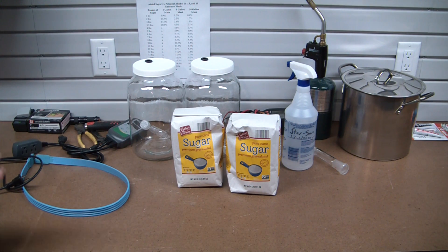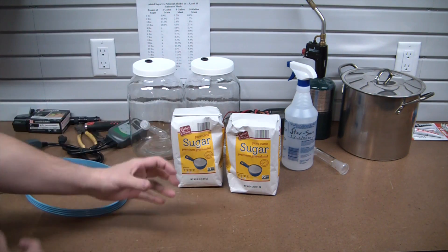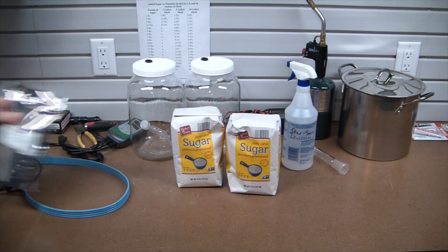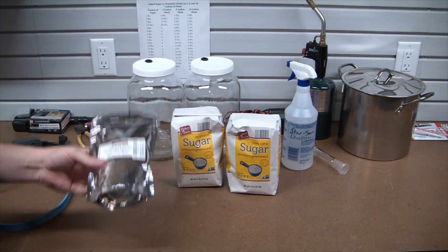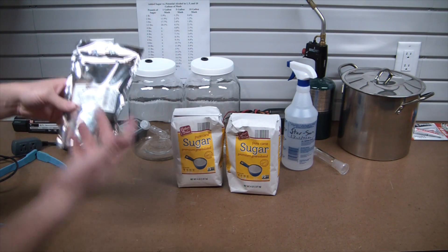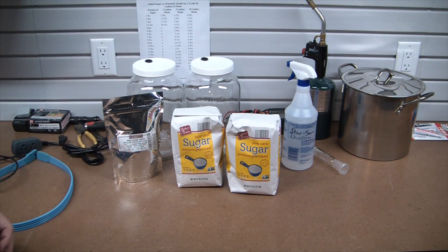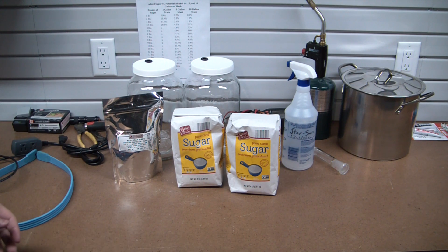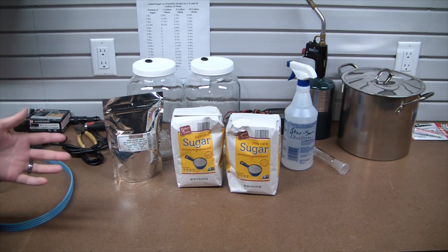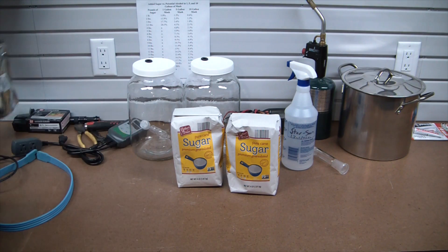I don't have to crack down but these are the yeasty little bastards we'll be using to do it. This is Red Star DADY, distillers dry active yeast, and apparently you can get up to about 20 percent alcohol under the correct conditions, which we are going to be giving it.